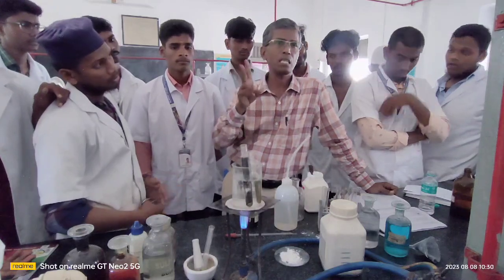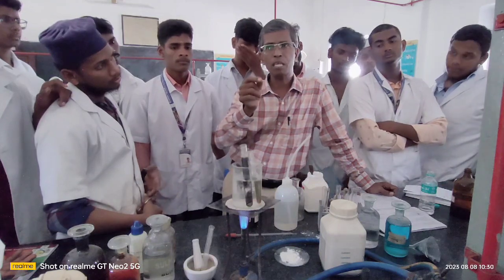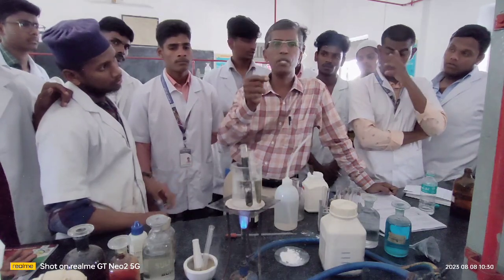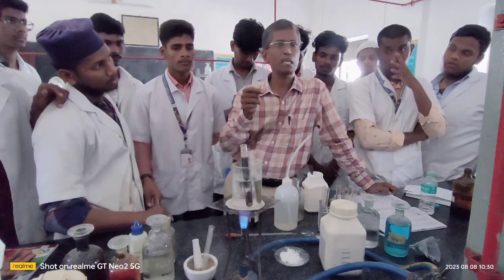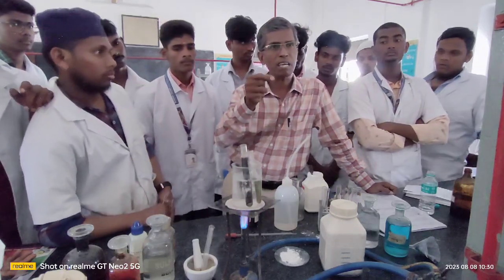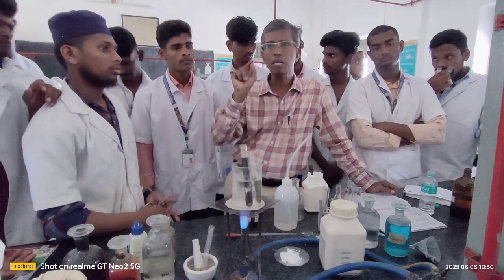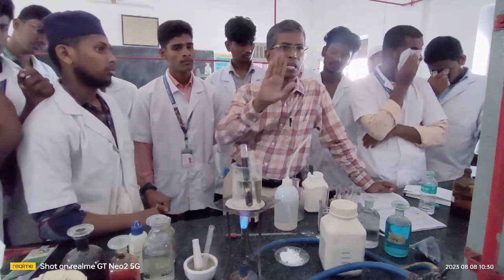And the next test is aromatic or aliphatic. Take a little of the given organic compound, the suspected compound to be analyzed, on a spatula, and introduce it into the blue edge of your Bunsen flame. If the organic compound catches fire and burns with a lot of sooty, luminous flame, that confirms the presence of aromatic compound, otherwise aliphatic.